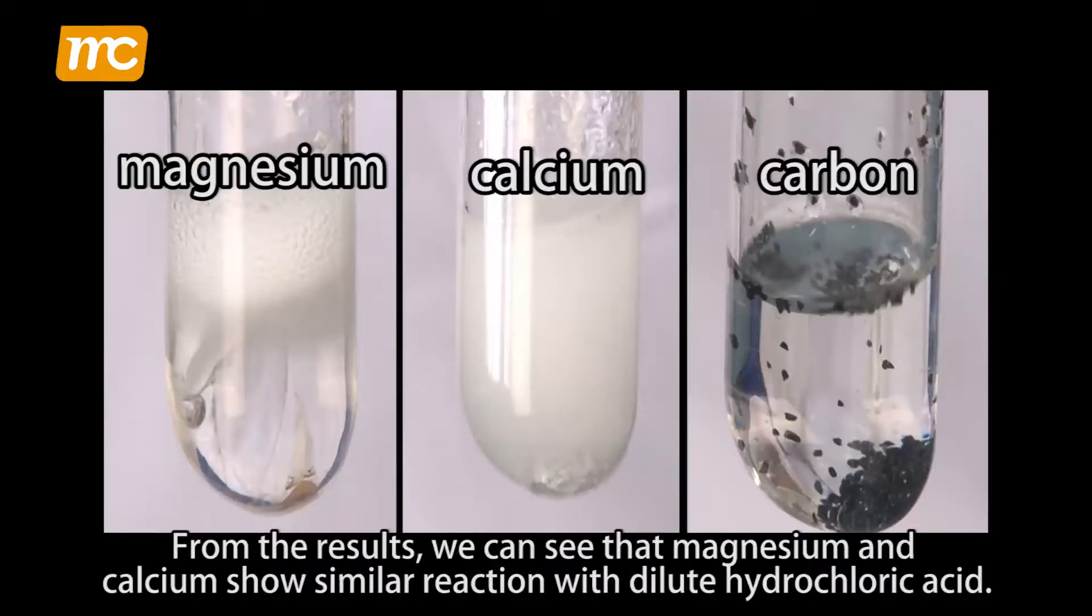From the results, we can see that magnesium and calcium show similar reaction with dilute hydrochloric acid.